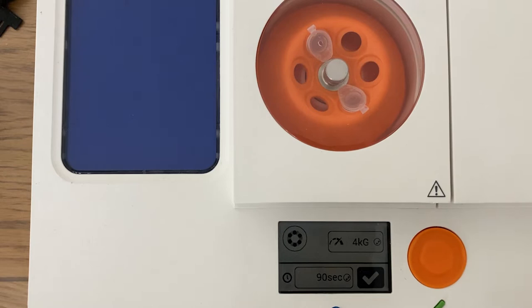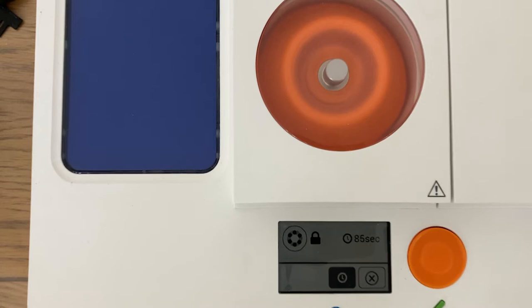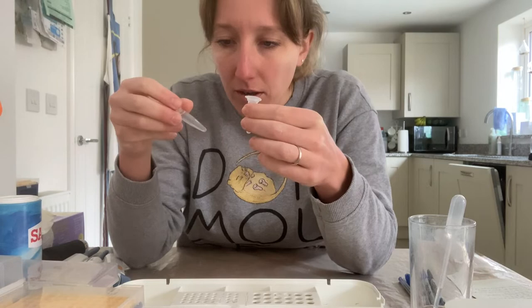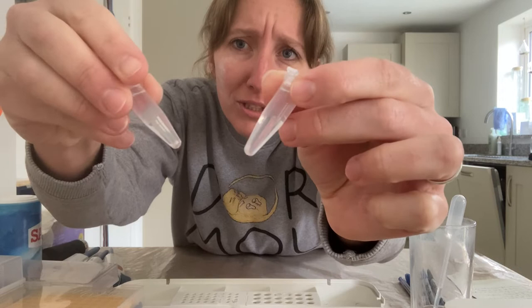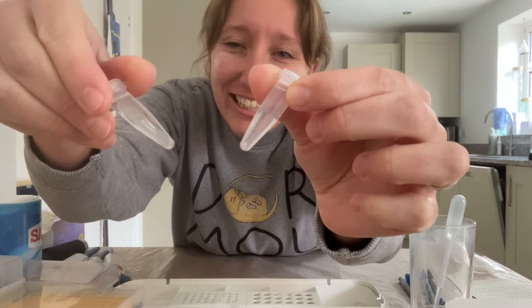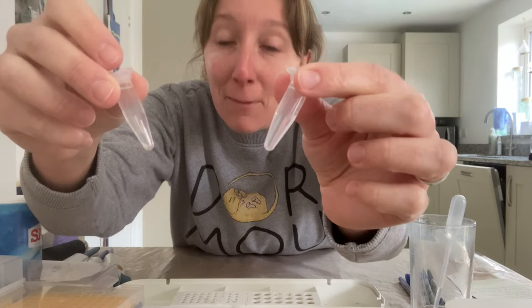Because I had quite a lot of salt water with spit and I needed to balance the tubes for the centrifuge anyway, I created a second spit sample and am running the DNA extraction in duplicate — it's always a good idea to have two attempts at something. In the centrifuge now are my two spit samples, set at 4000 g for 90 seconds. After spinning, the skin cells have collected at the bottom, but awkwardly there's also a little bit of chocolate Weetabix in one sample — good thing I did it in duplicate. Hopefully we'll extract DNA from me and not my breakfast.